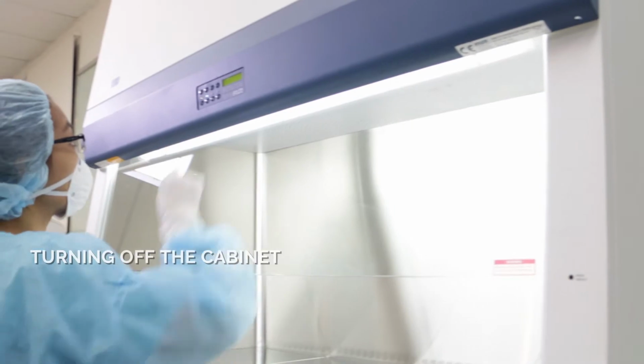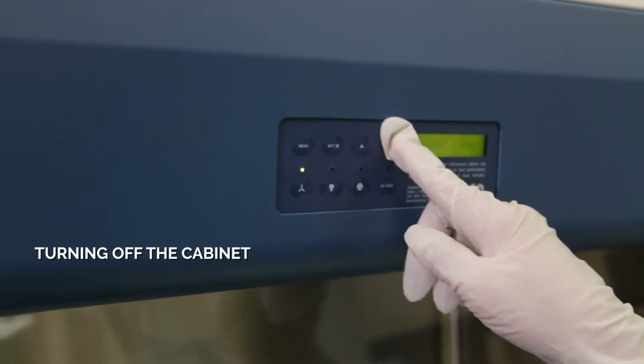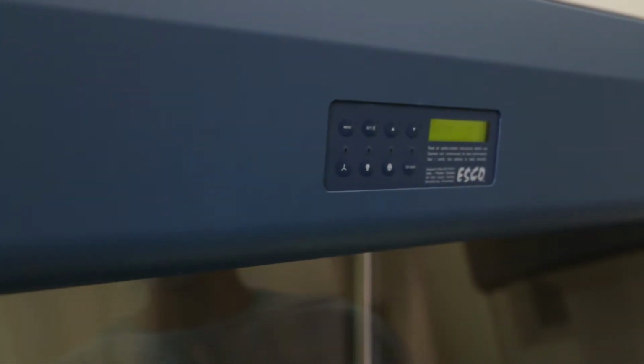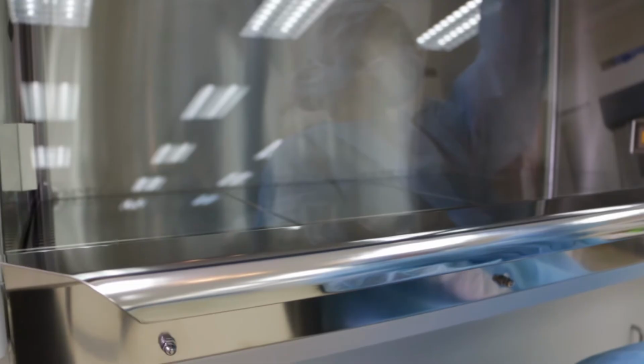Turning off the cabinet. Turn off the fan by pressing the fan button. Input the fan pin. This will also start the post-purge procedure. During the post-purge period, all the buttons are not operational. Lower the sash to the fully closed position. The sash can be lowered immediately after turning off the fan, as it will not interrupt the post-purge procedure.